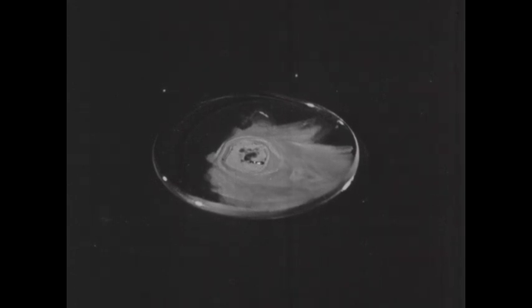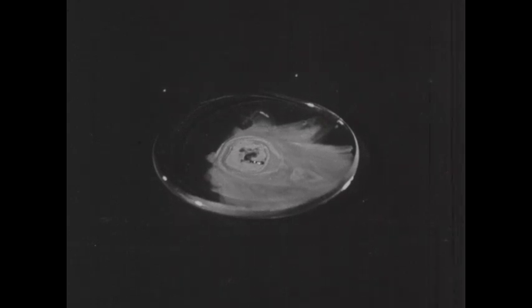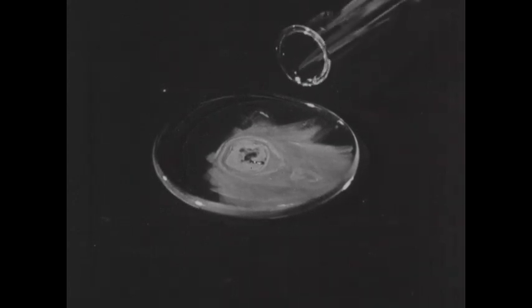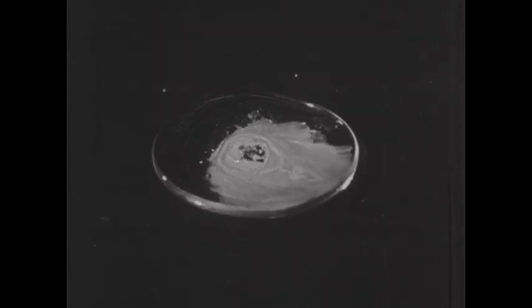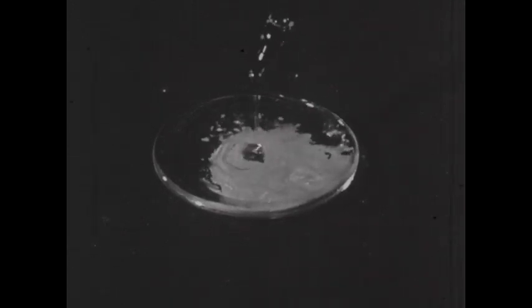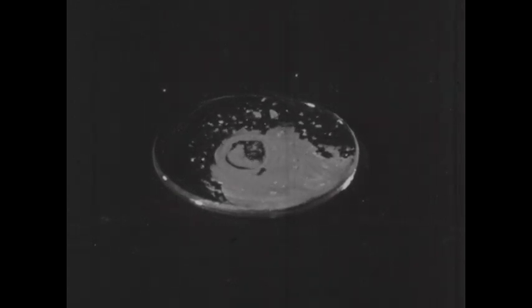Since phosphorus is a non-metal, its oxide formed during the combustion should react with water to produce an acid. Some of the phosphorus pentoxide will have remained on the watch glass, and a few drops of water are added to the residue. Adding a few drops of methyl red indicator — which assumes its red color in acid solution — the appearance of the bright red color confirms our prediction that phosphorus pentoxide reacts with water to form an acid solution.